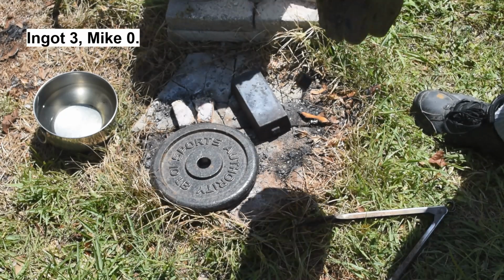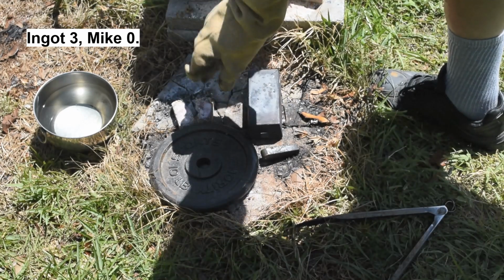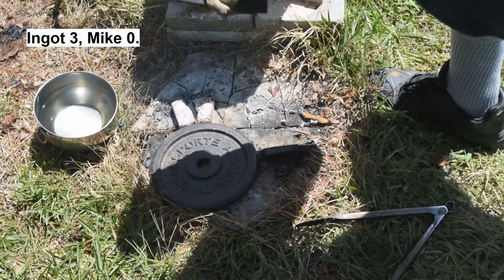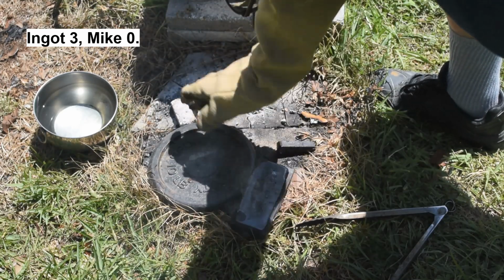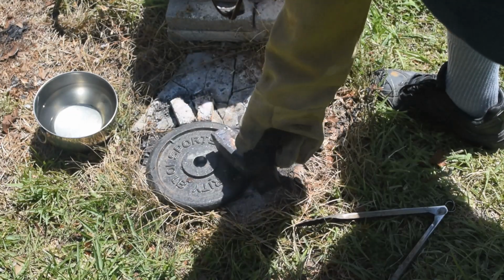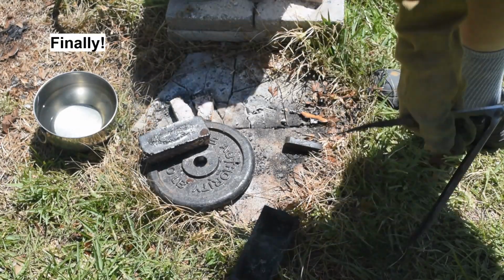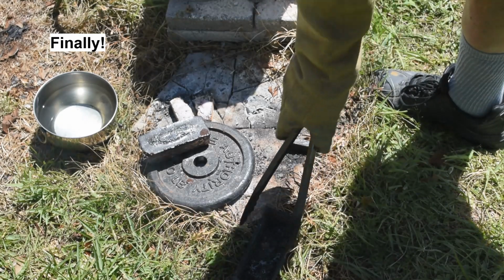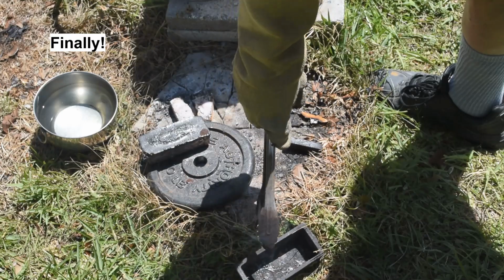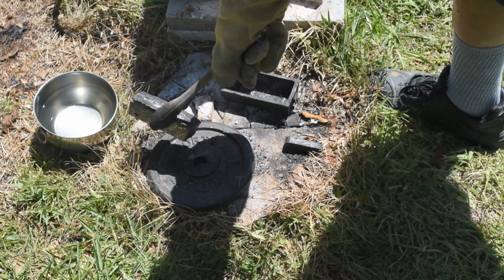Whoa! Well, that wasn't supposed to happen. These don't make loaf molds like they used to, I guess. Well, there's the copper. Huh, it only cost me a loaf mold. I guess I could still use it, it just doesn't have a handle anymore. Huh. Okay.